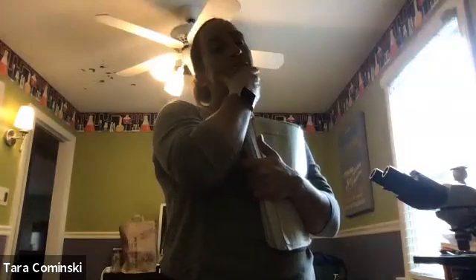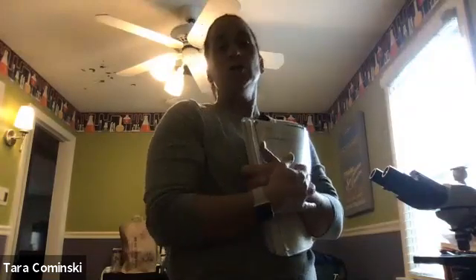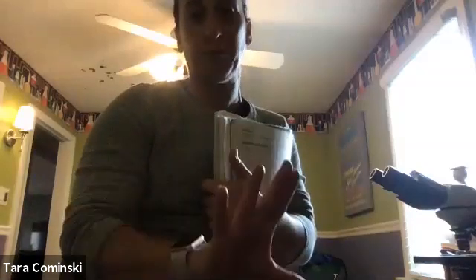We will now move on to microscopy. Like I said, I'm going to show you what's in the microscope with my phone. So you know what? I'm going to end this meeting and start a new recording, so we have 2 separate videos.